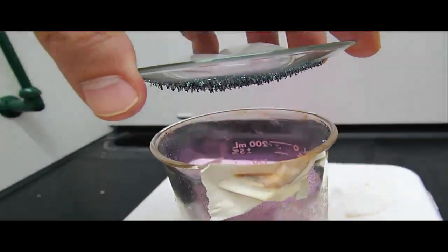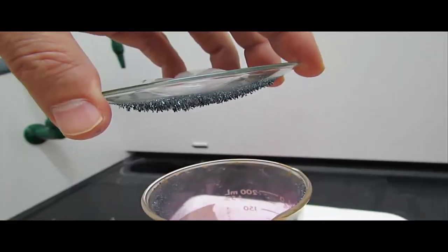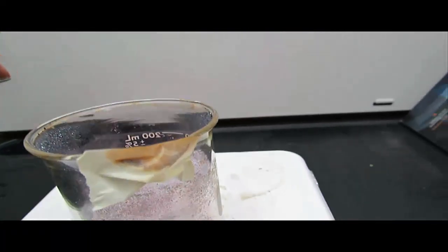So here in this video I'm actually taking the watch glass off, you can see the iodine gas escaping, and then you can see those iodine crystals there.